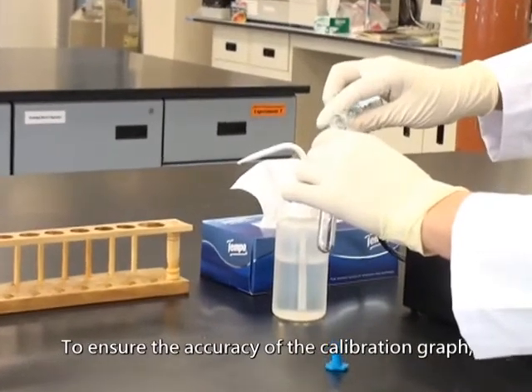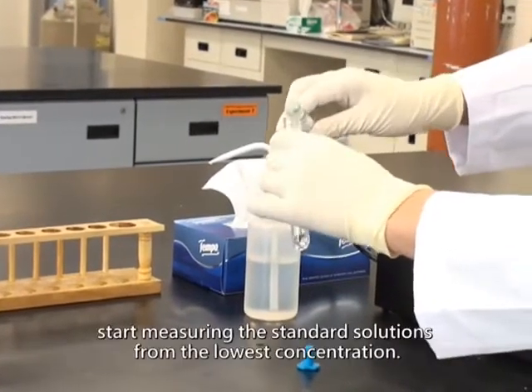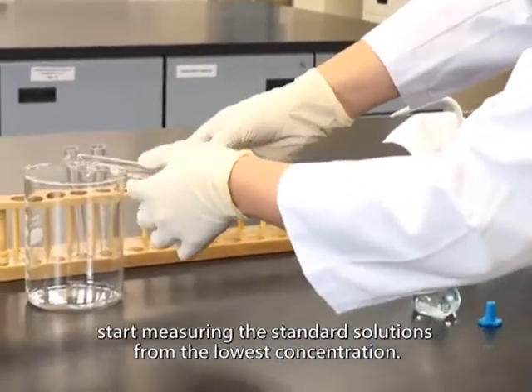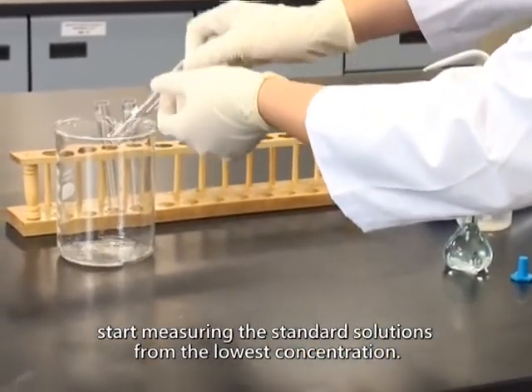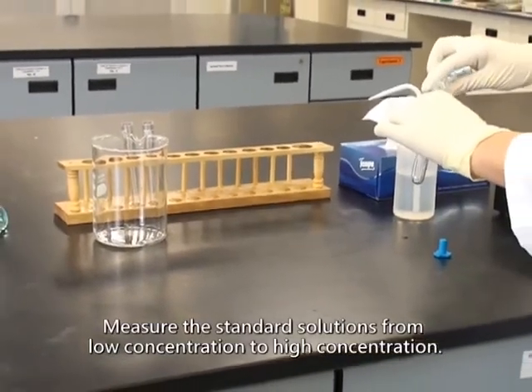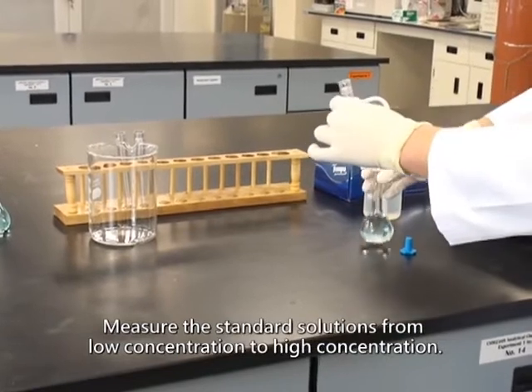To ensure the accuracy of the calibration graph, start measuring the standard solutions from the lowest concentration. Measure the standard solutions from low concentration to high concentration.